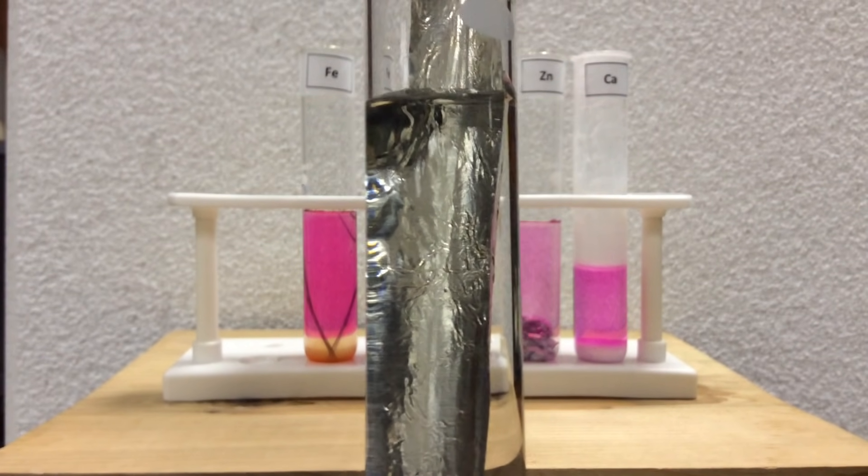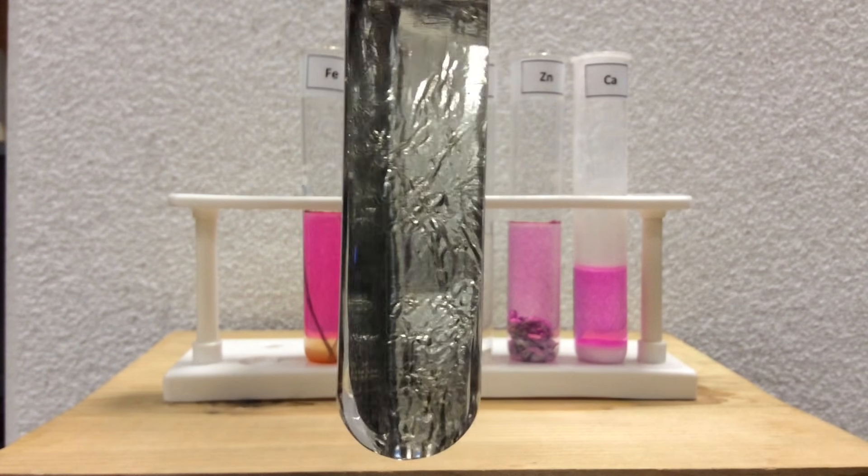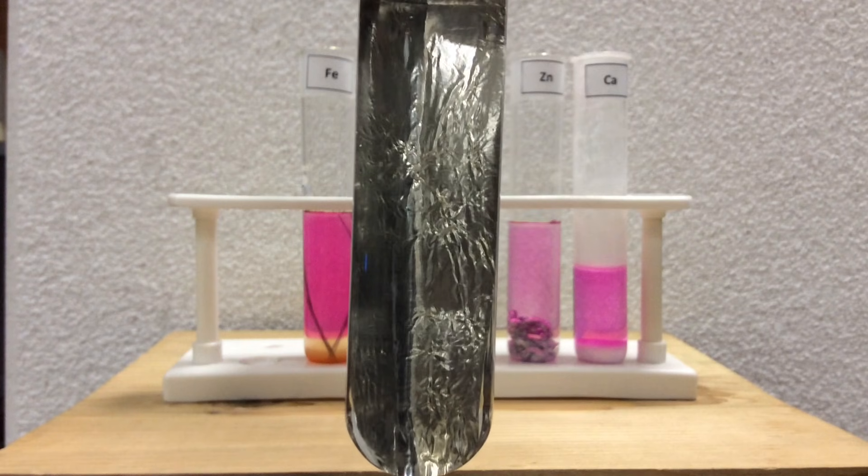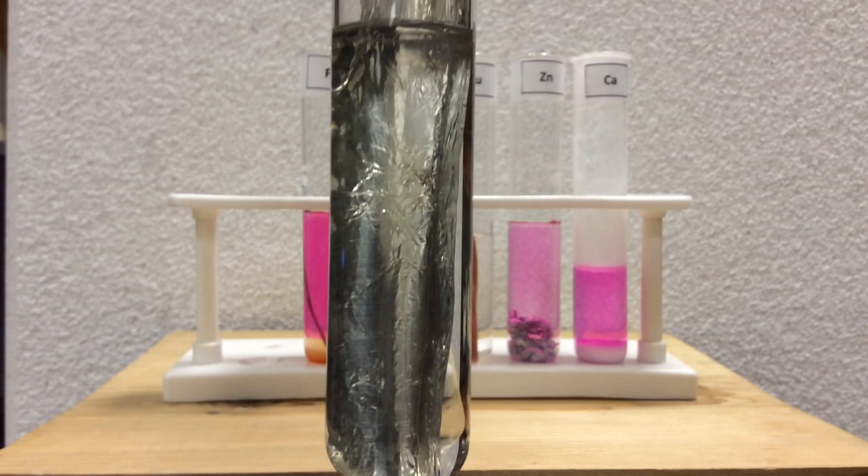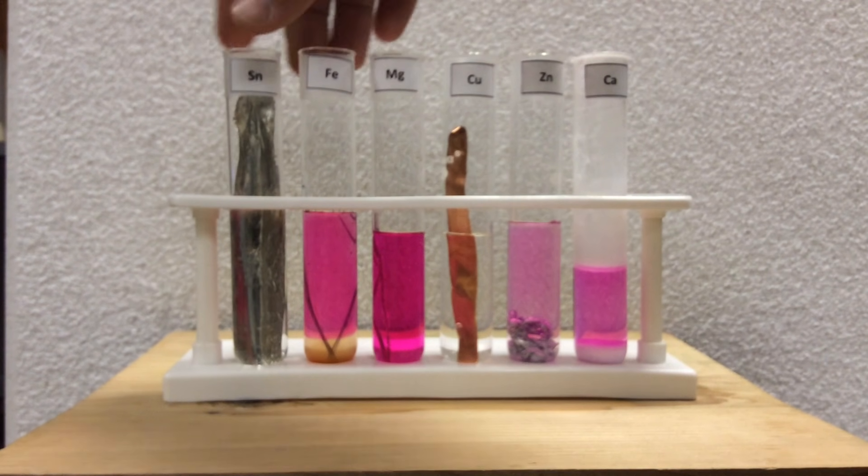So, tin is really pointing us to believe that there is limited, if any, reactivity whatsoever. Hard to see if there is some. All right? That may have to stay for a longer period of time if it is reactive or heated to increase the rate of reaction.